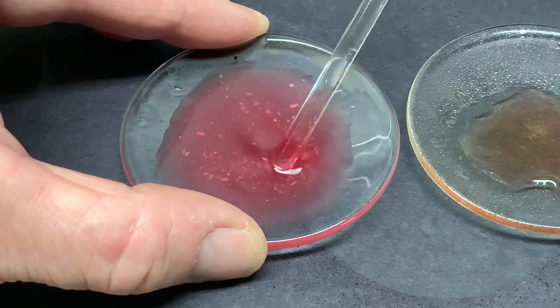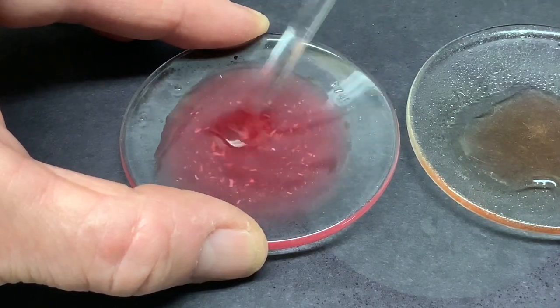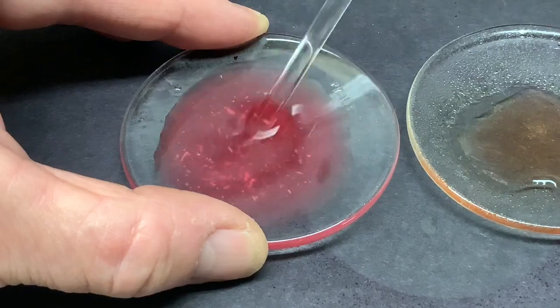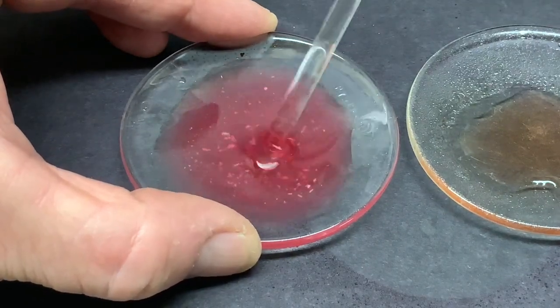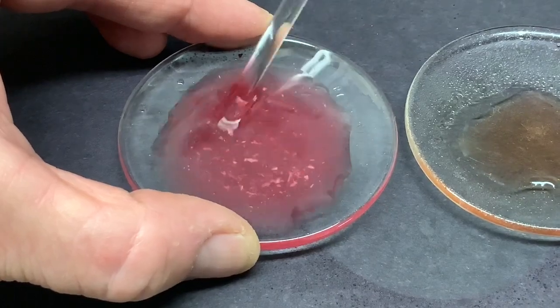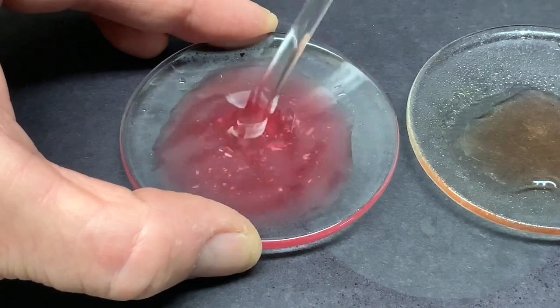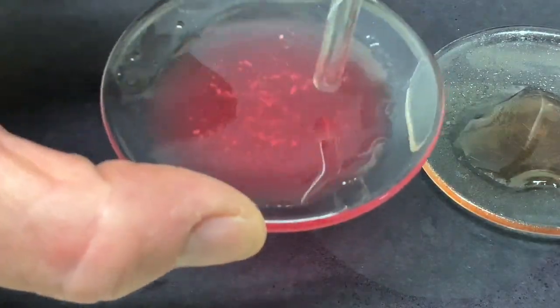Finally, quite a bit more acid has been added and it's got a bit more red food coloring in it, and the solution is no longer cloudy. There are still bits in there; not sure why those aren't disappearing, but the solution is far less cloudy than at the start.